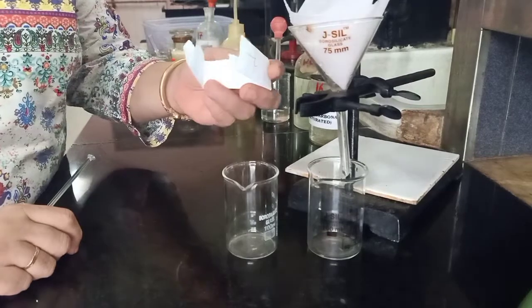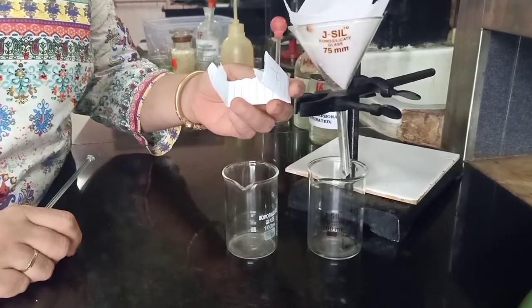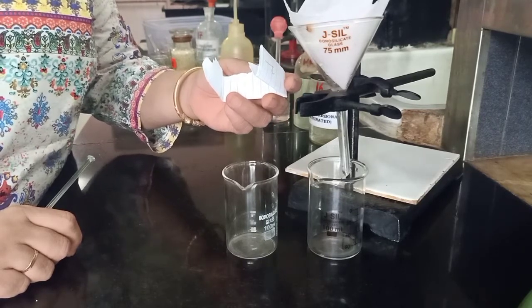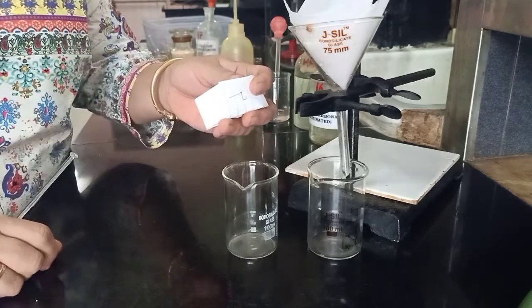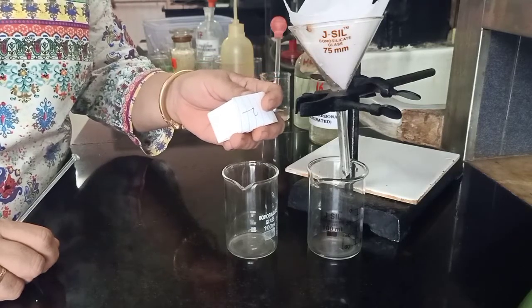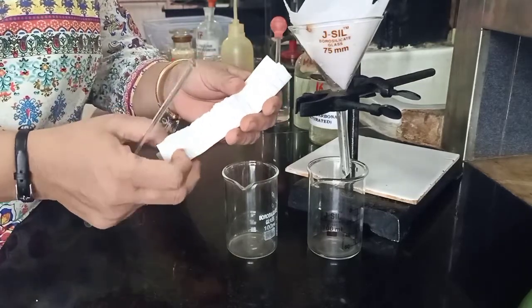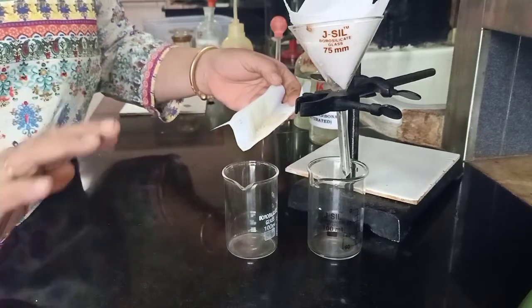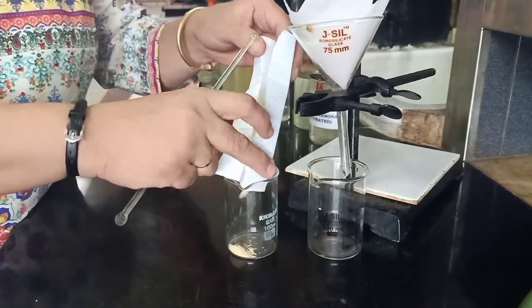We are now going to proceed with the separation of the mixture. The mixture type is water-insoluble acid and water-insoluble base. Our separating agent is sodium bicarbonate. This is a weight packet which will be provided to you after you have the signature of the teacher or examiner on the mixture type, separation reagent, and separation method. This weight packet has the weighed quantity of the mixture. All earlier parts of the mixture must be disposed, and this portion is to be transferred to a beaker.